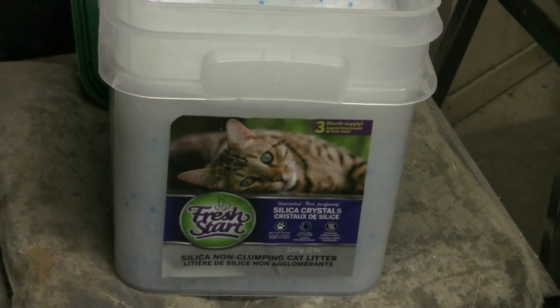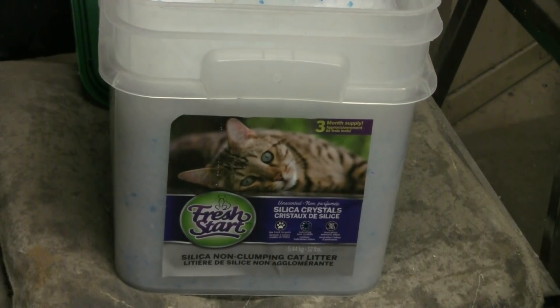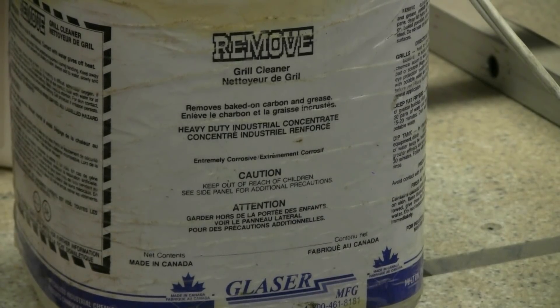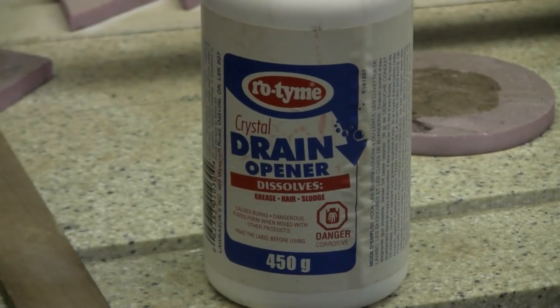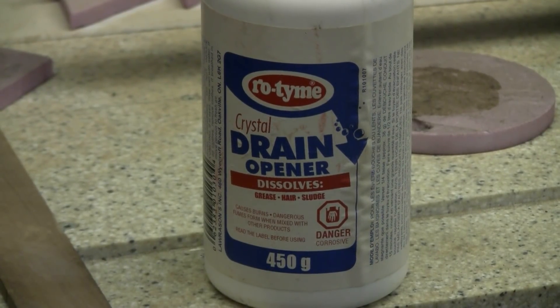Let's next take a closer look at the sodium hydroxide or lye. Here's the label on my liquid sodium hydroxide — it's sold as a grill cleaner. It works well for cleaning grills, but I'm going to use the rest of this gallon for making sodium silicate. This other form is solid crystals in a one-pound container, which would simply be dissolved in enough water before use.